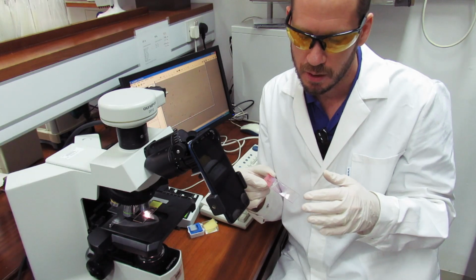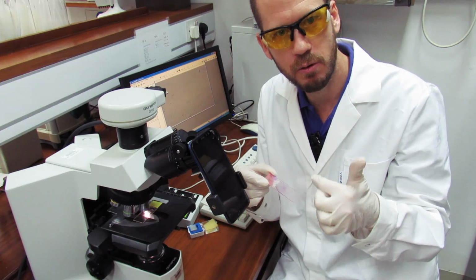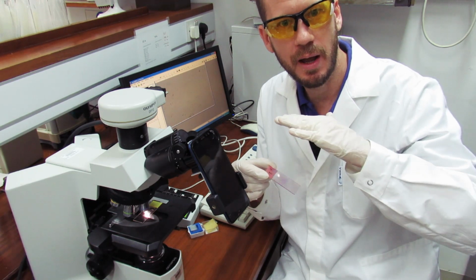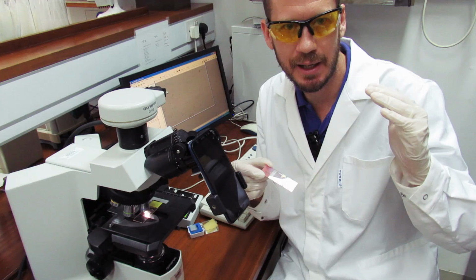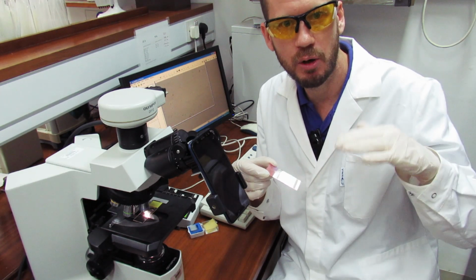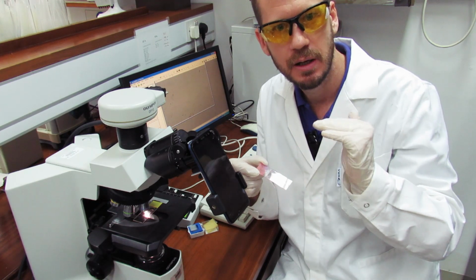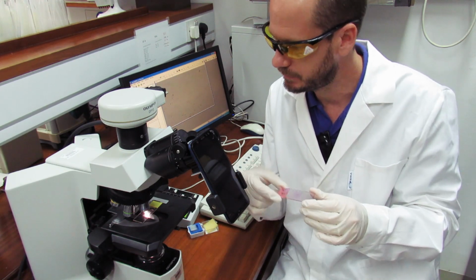And there's a small square on the top. This small square is the slip. It's just to give that moist material constant thickness, less than a millimeter, and it spreads out the microbe so you don't have many layers of cells, almost a single layer, because of the slip sticking over the slide.